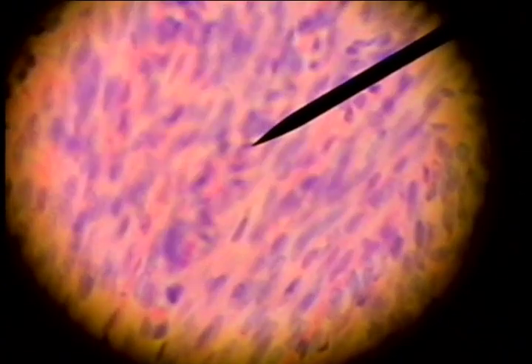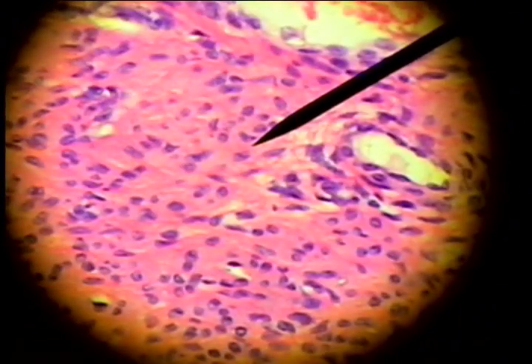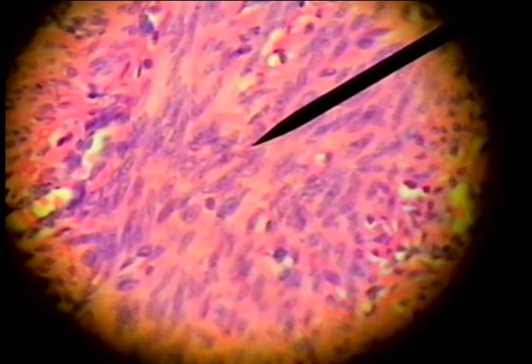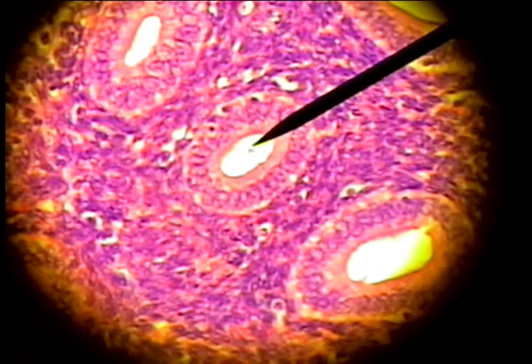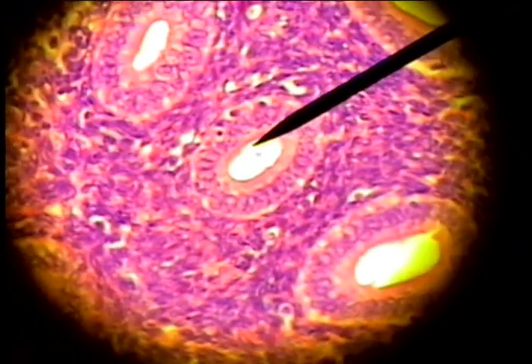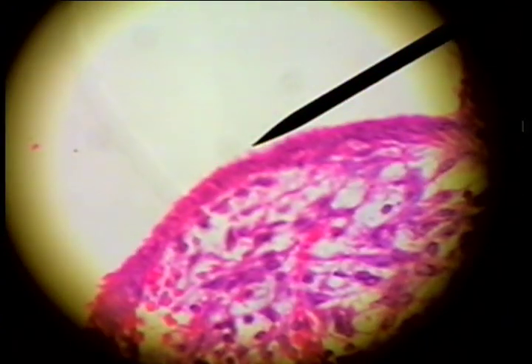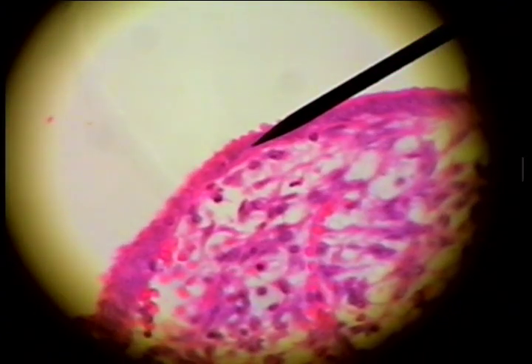That would be the outer serosa, and then we can see these smooth muscle cells in a swirling pattern located in the muscular layer. Then we get up into the tubular or glandular layer of the endometrium and we see these tubular glands or uterine glands lined with a simple columnar epithelium, and then finally the inner surface lined with a cuboidal to low columnar epithelium.